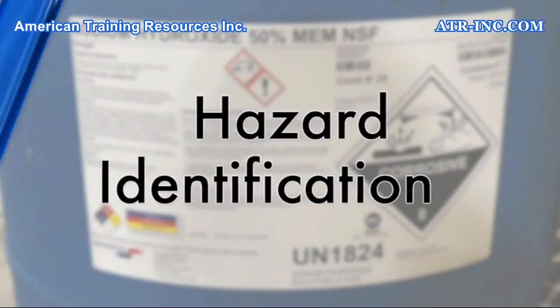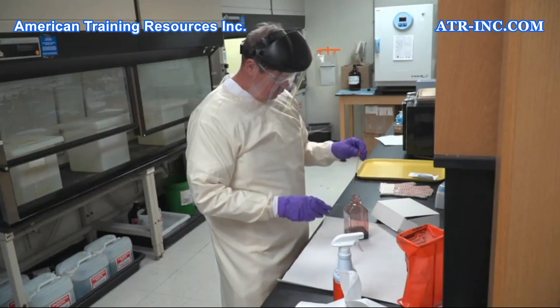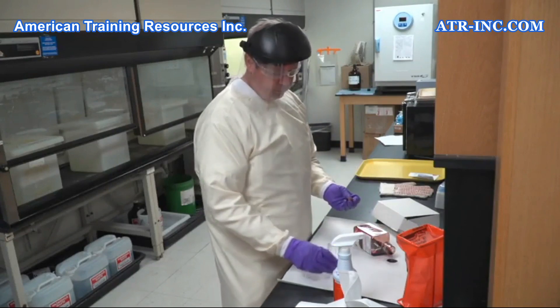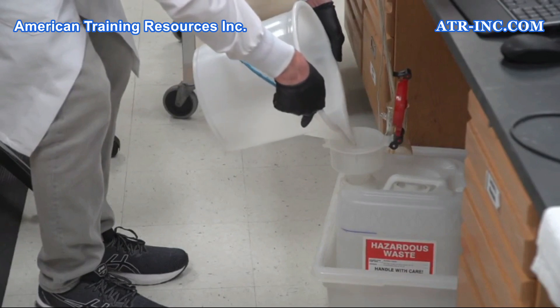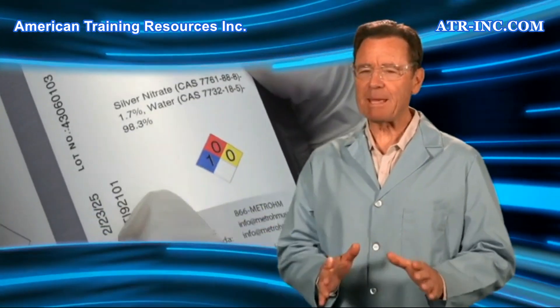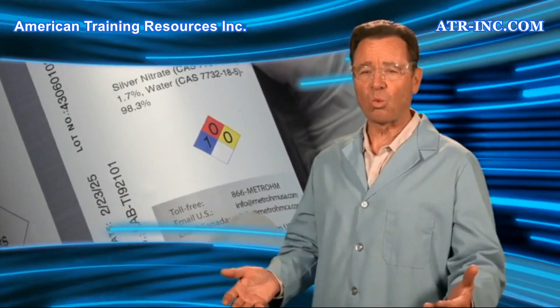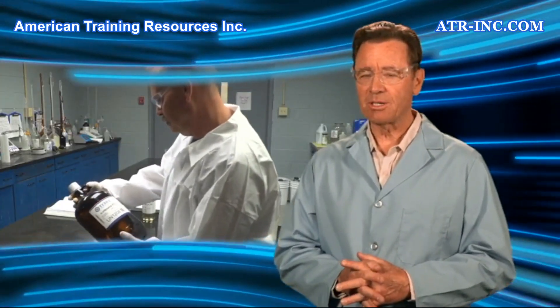Hazard Identification. One of the most common hazards faced by laboratory workers is being exposed to a hazardous chemical or substance. To properly protect themselves from harmful exposure, lab workers must be able to easily identify the chemicals they plan to work with and quickly determine the chemical's hazards and any necessary safety precautions.